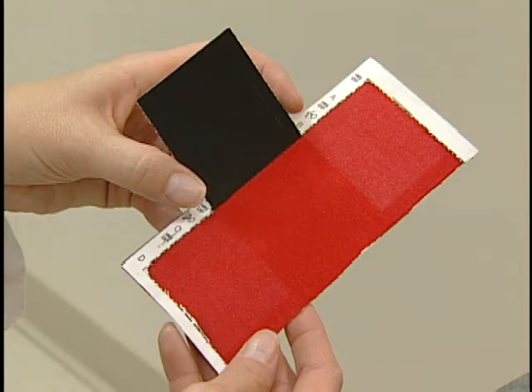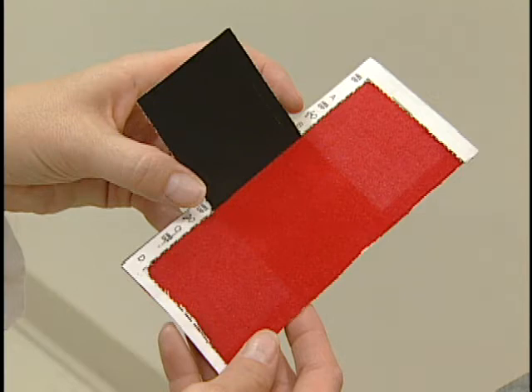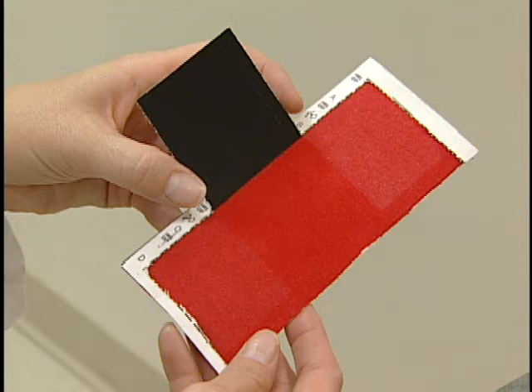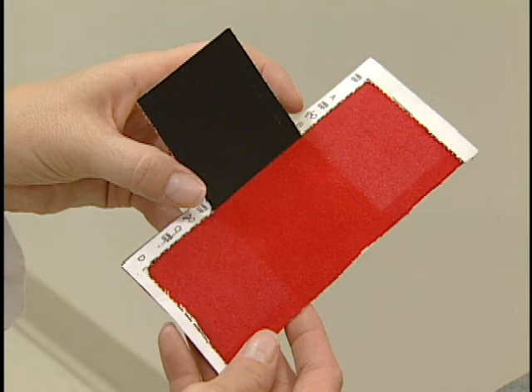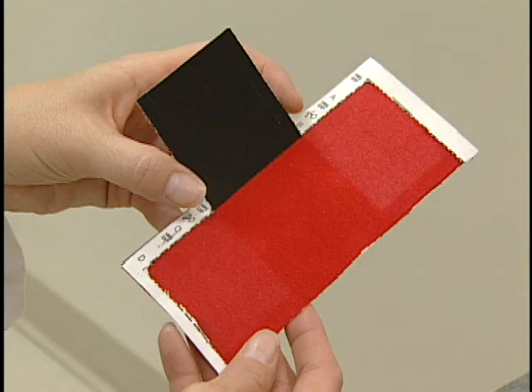Upon completion of the test, the specimens are rated to color change. The AATCC Evaluation Procedure 1, grayscale for color change, is normally used for the evaluation of color change due to exposure to light. Instrumental color measurement is also an option for evaluation.